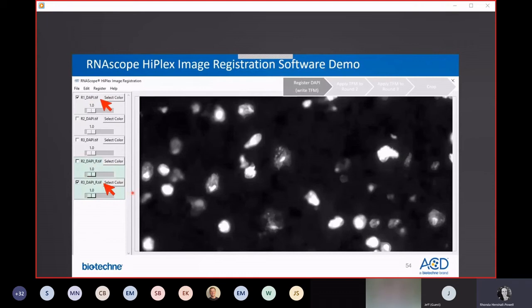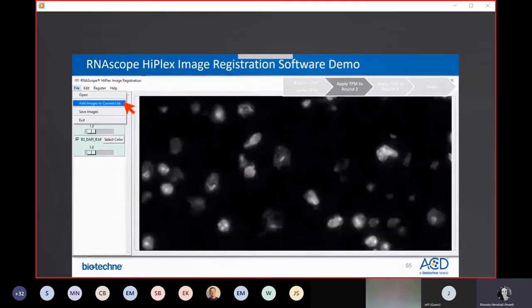Once that's done, you can remove the DAPI images you don't need, because keeping all of these images of DAPI creates redundant DAPI signal. You don't need them, they've served their purpose at this point. But now it's time to align the other channels from round 2 and round 3. So if you go up to the File menu again, select Add Images to Current List. Selecting Open here will clear the files from the dashboard. You want to add more images, not start a new one.